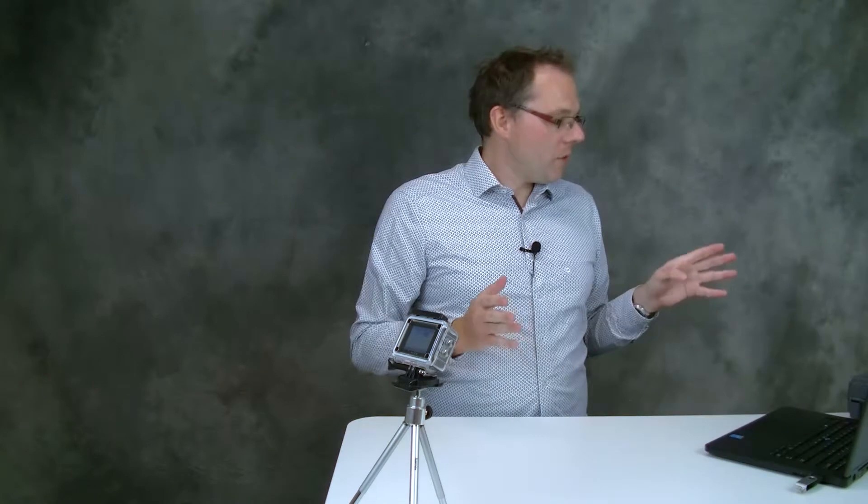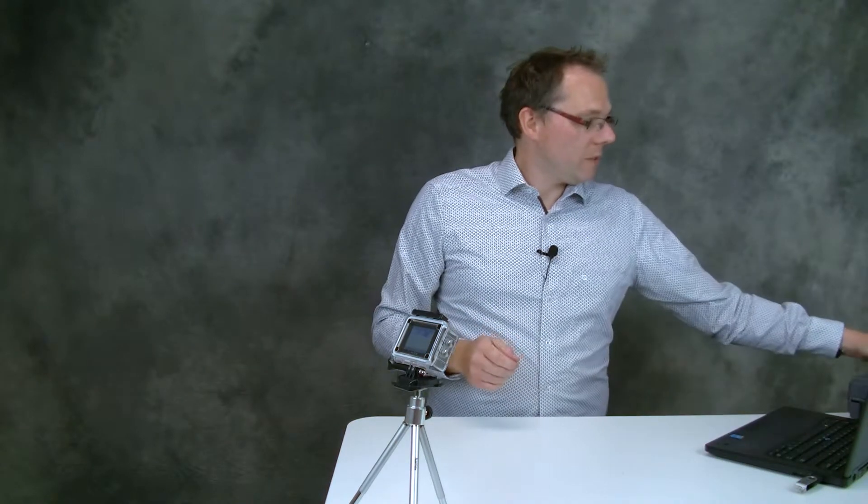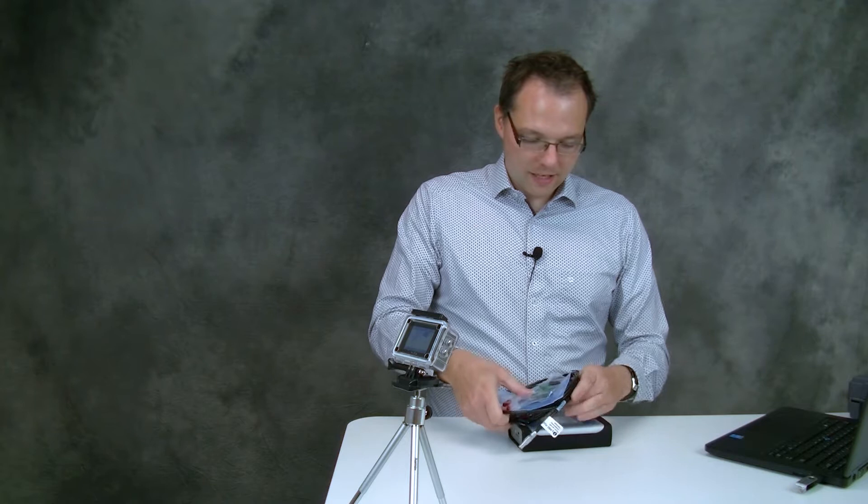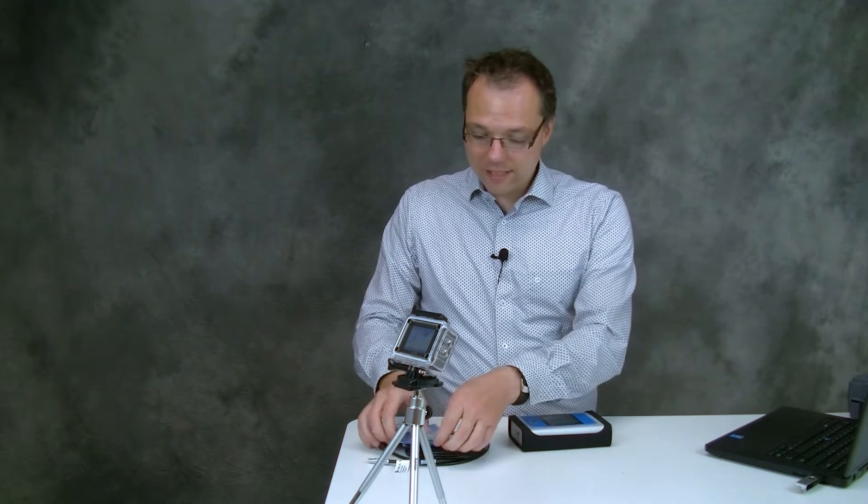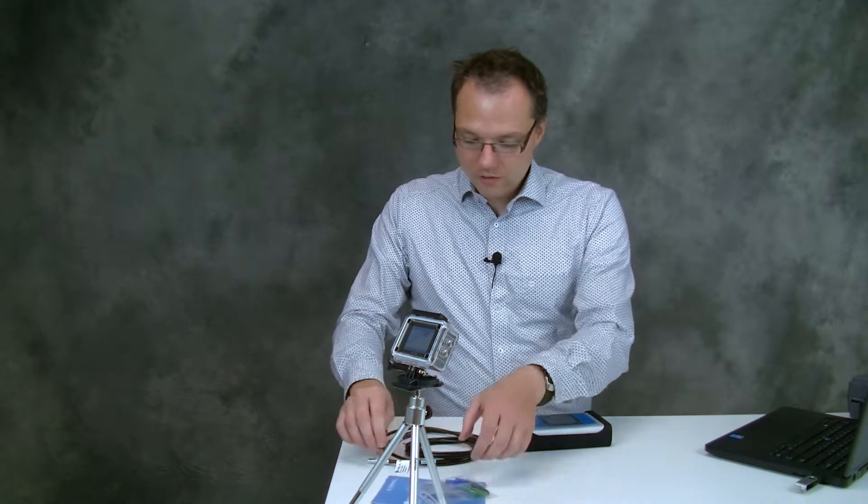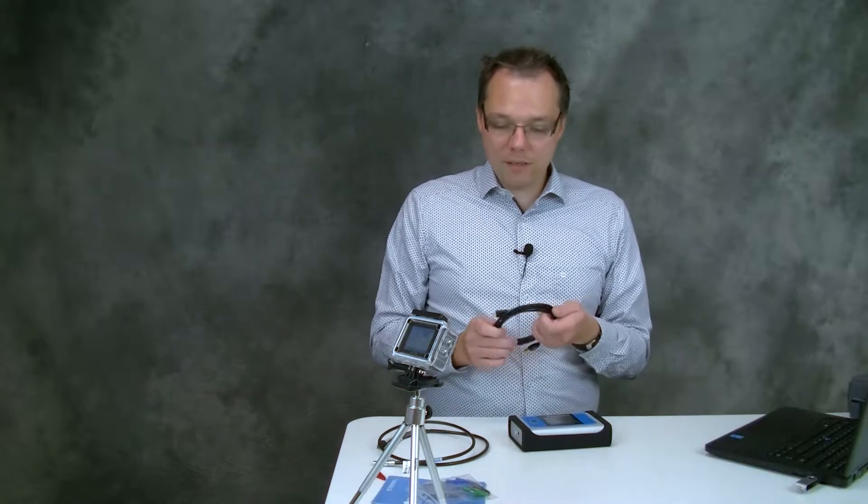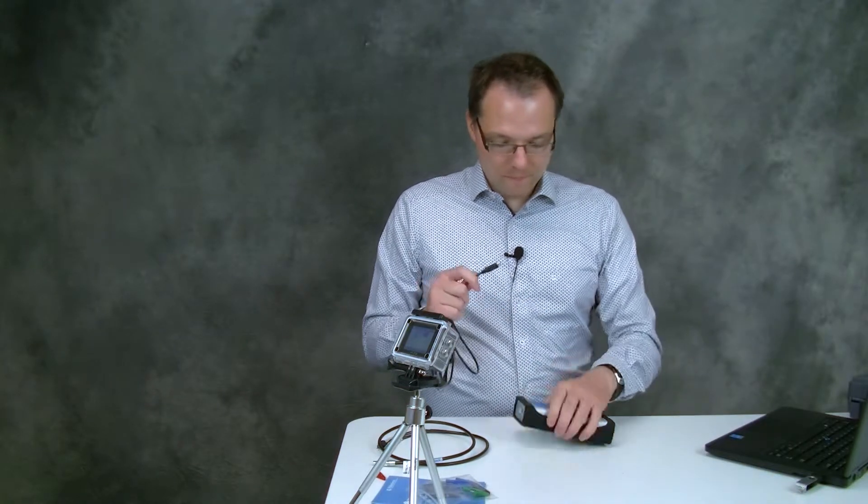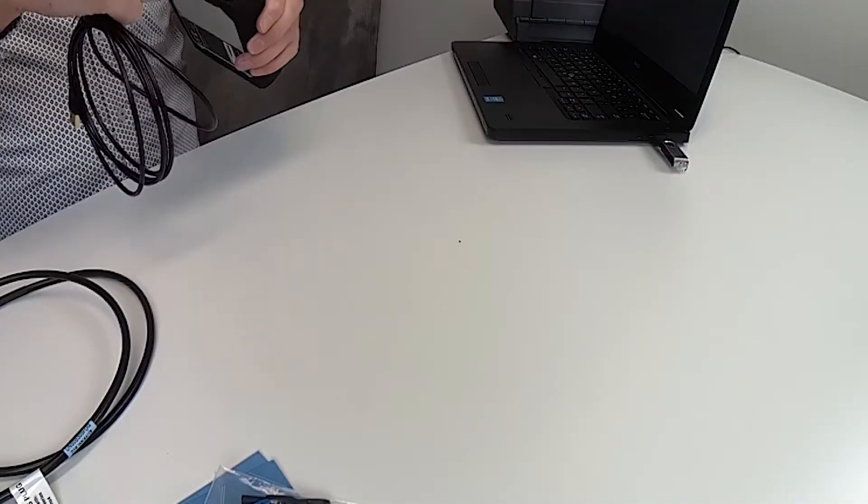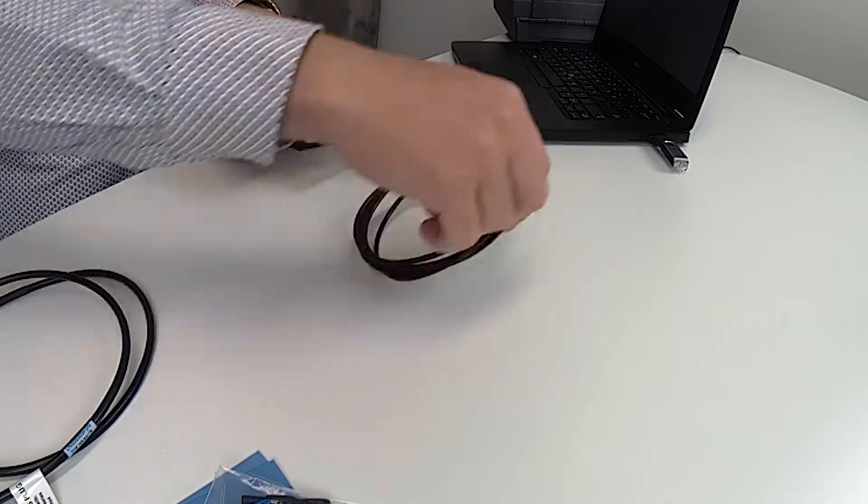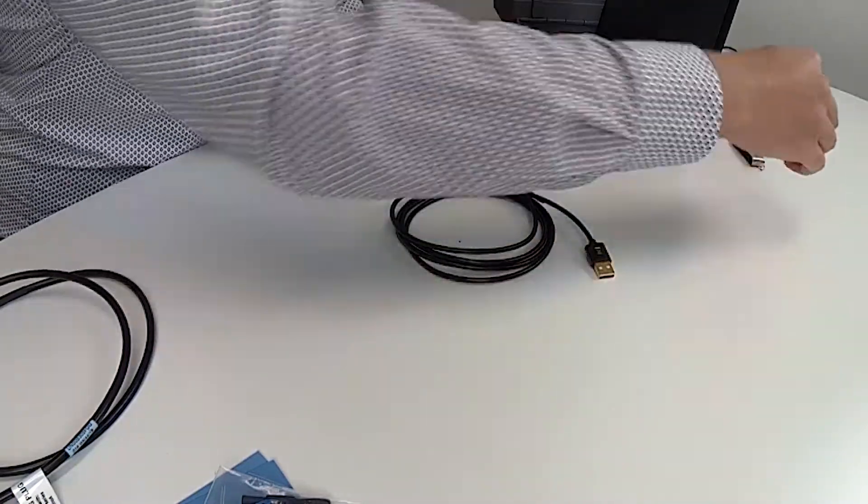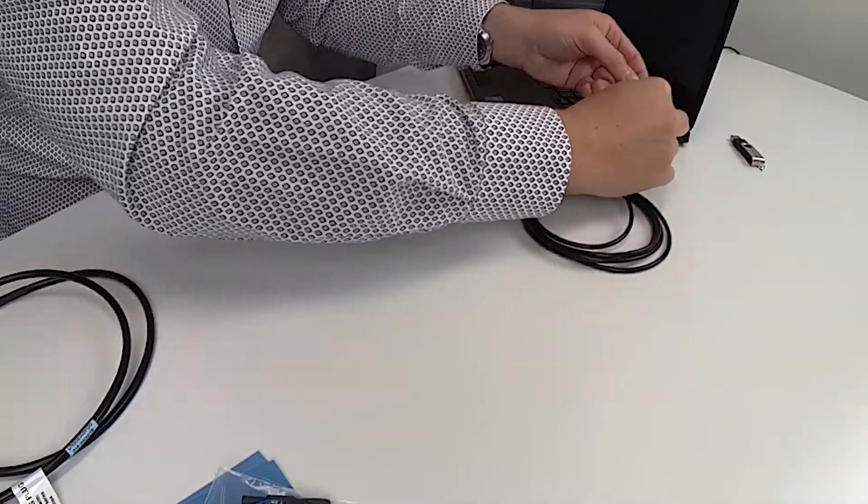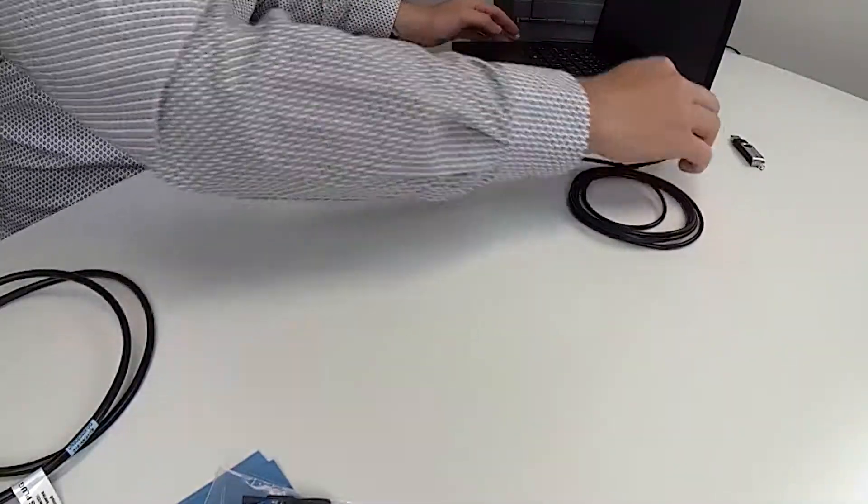Well now we have installed PS Trace and now we want to do our first measurement. Now for the first measurement we of course need the potentiostat and the cables that came with it. So first we want to connect the potentiostat to the computer. For that you just connect the USB plug and let's use this USB port for our potentiostat.